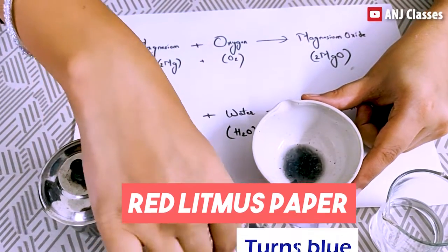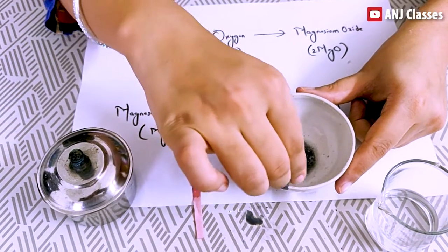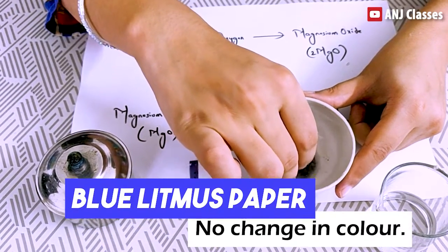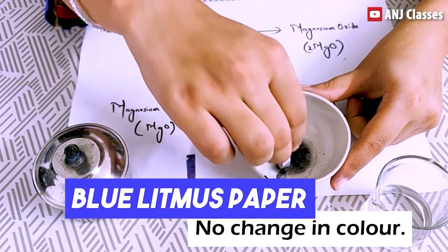Now I will test with blue litmus paper. Here you can see there is no change in color.